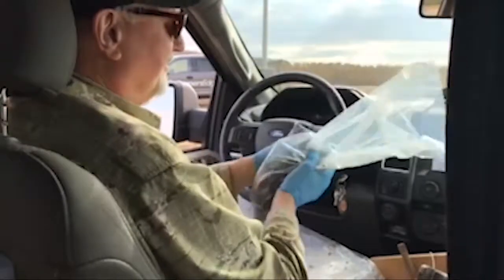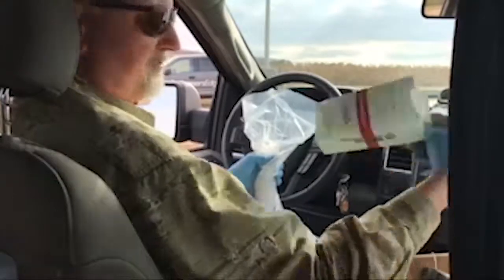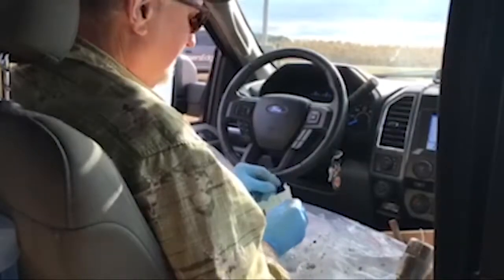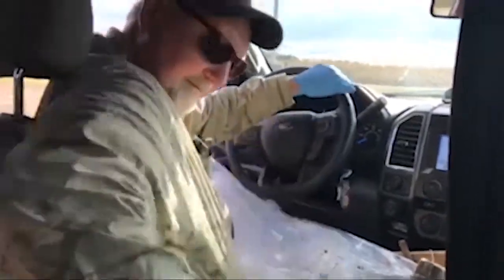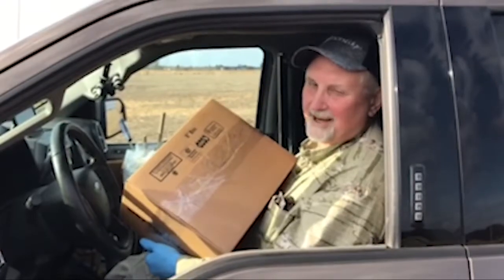I like to mix it up so you get a pretty representative sample, and then I'm going to pour it into one of the smaller bags. Now we're going to slap a label on this and send it to the lab.